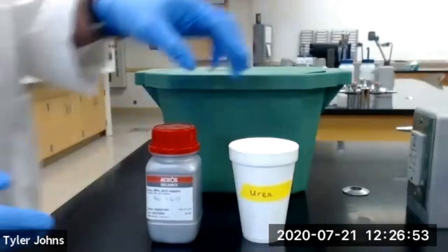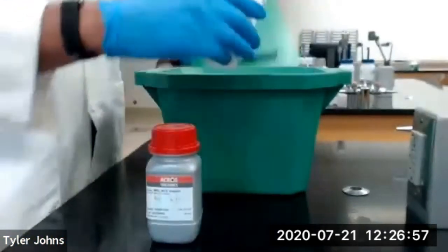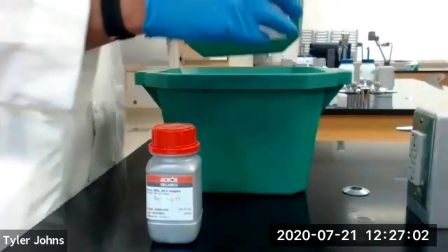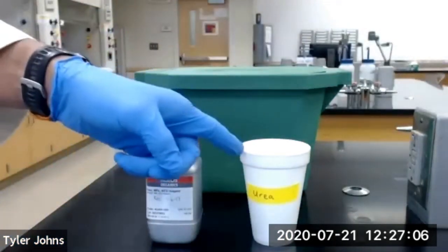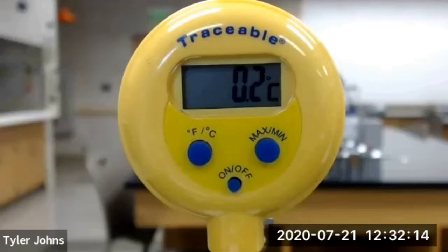We first need to fill our styrofoam cup halfway full with ice, and we then need to determine the initial temperature of the ice in our styrofoam cup. The initial temperature of the ice inside of our styrofoam cup is 0.2 degrees Celsius.